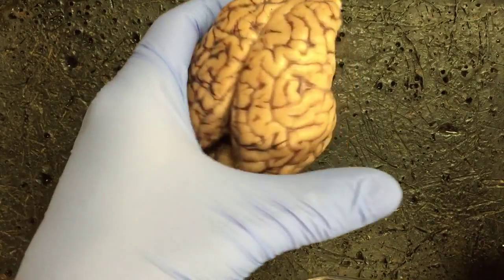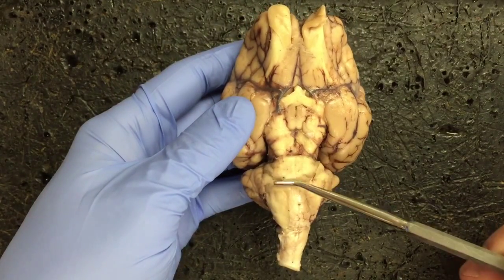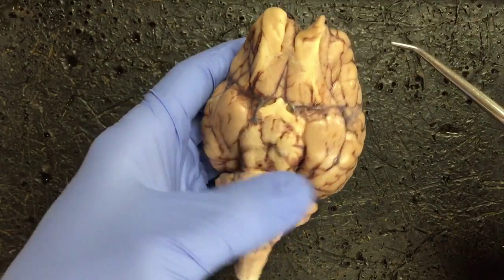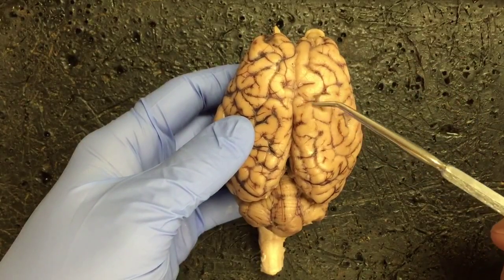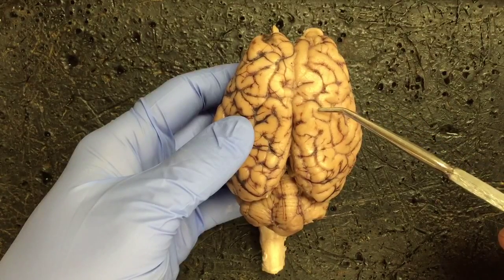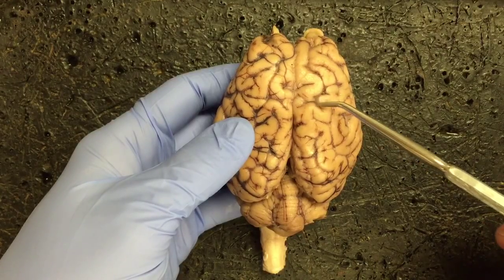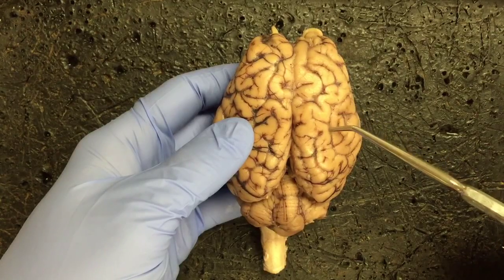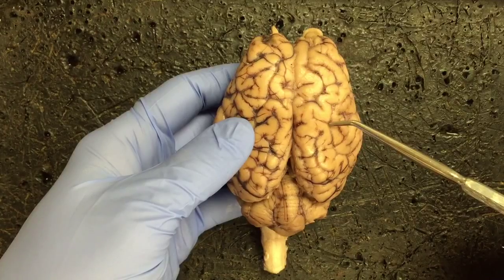Next, we're going to look at the pons, so we're going to have to look at the ventral surface of the brain. This enlargement right here would constitute the region that we would call the pons. The next pair, gyrus and sulcus, go together. Gyrus is a generic term, so if I pointed to any raised area of the brain, you can see these kind of ridges that are folded up. That would be a gyrus. Gyri would be plural of that. The ridges end in these little grooves, and this would be a sulcus. Any dark area with these blood vessels within it would be a sulcus. Remember, sulci is the plural for sulcus.